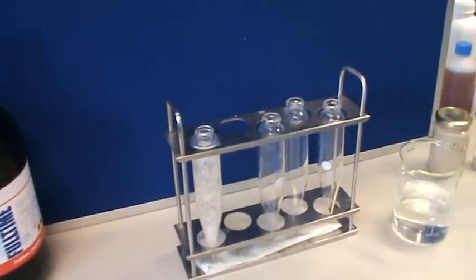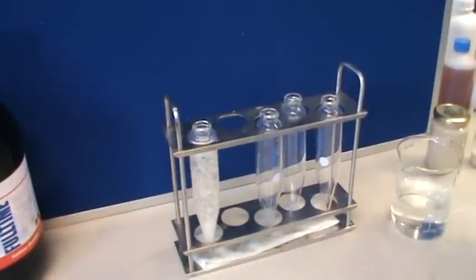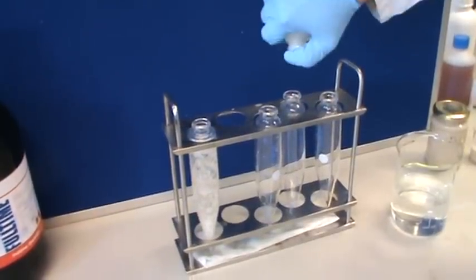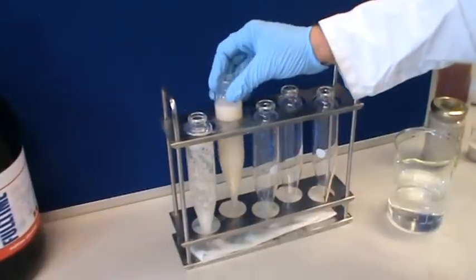And then once we've done this, we come back and have a look at what's happened after 5 minutes, and then it'll be half an hour and then 2 hours to see what has happened and whether the mixtures have gone off. So we'll look at one after 5 minutes.